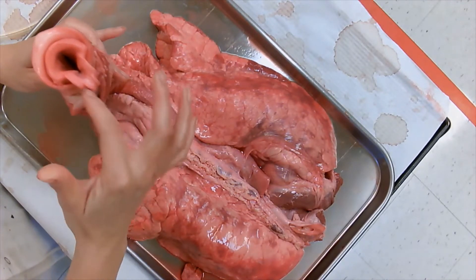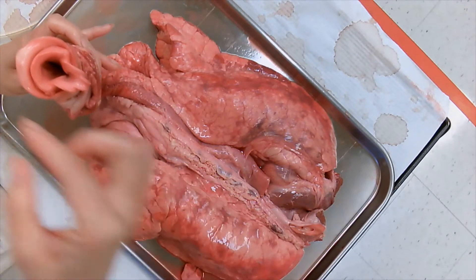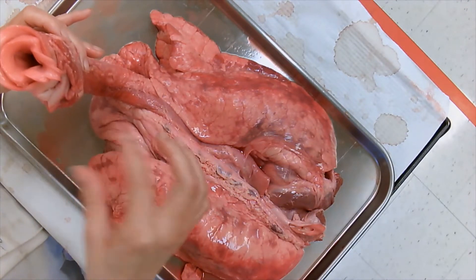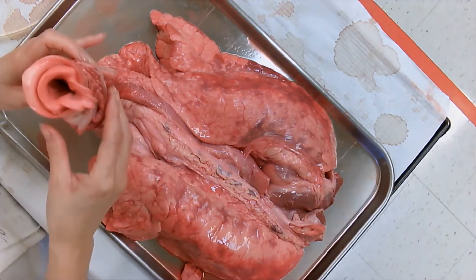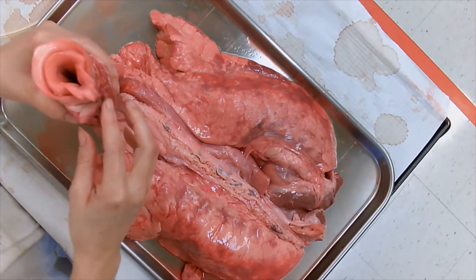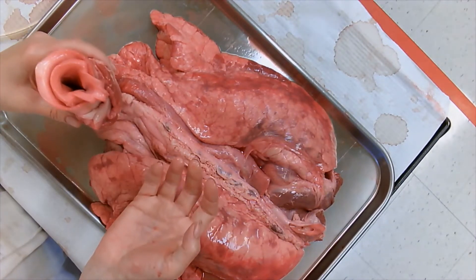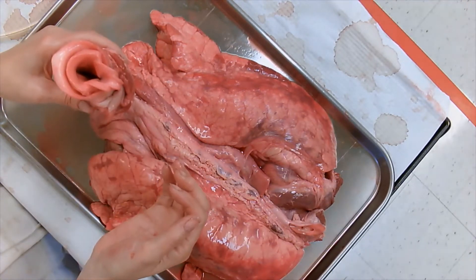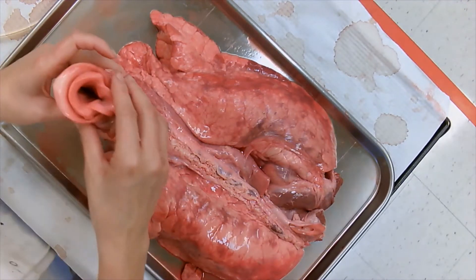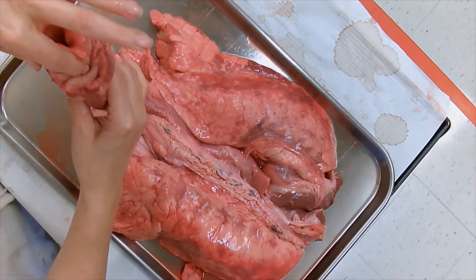Inside the larynx there's a kind of little V-section, and that little V-section is where your vocal cords are. So when you have laryngitis and you can't talk well, it's the inflammation inside here — inside the larynx.